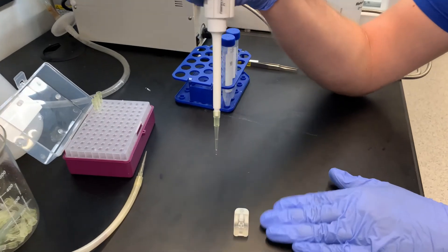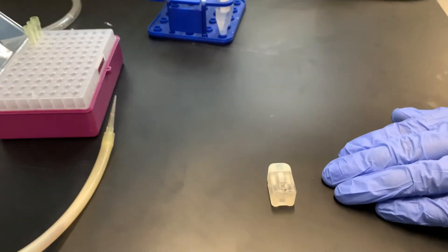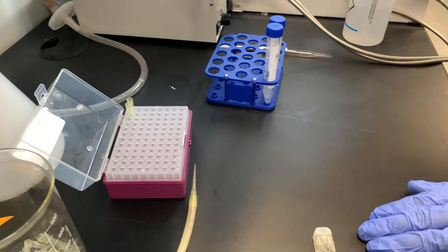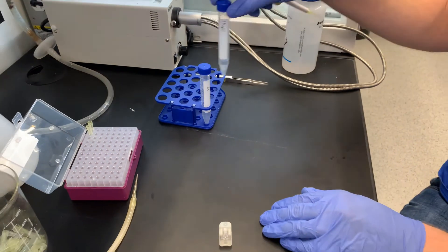Once IPA is flushed in both sides, you'll eject the pipette tip, get a new one and then do the same thing with KCL.